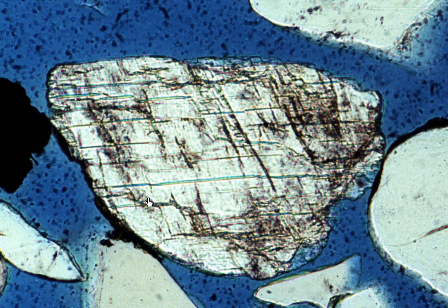In each one of these images, what you're seeing is a close-up image of the thin section picture. It's telling you here that we are in plain polarized light. Many of you will know what that means. In some cases, we'll be looking at cross-polarized light images, and in some cases, we'll be able to toggle between a PPL image and an XPL image.